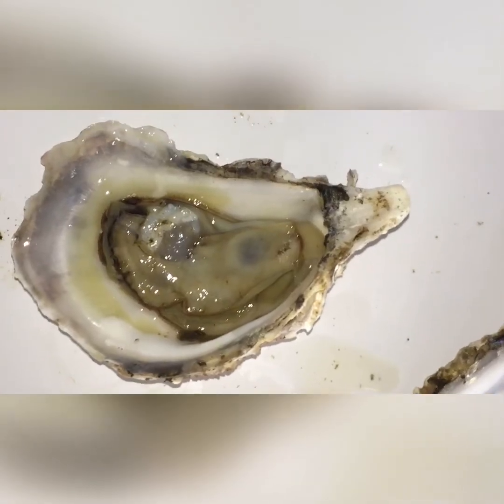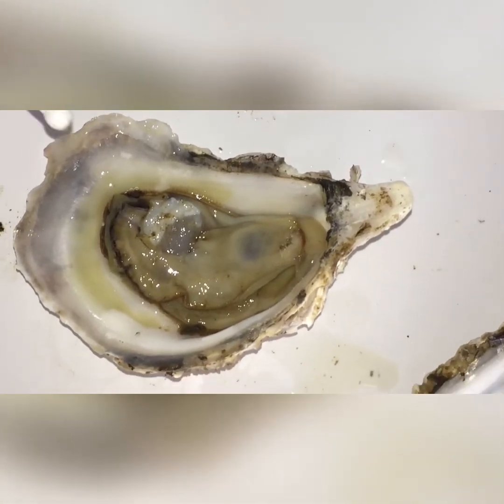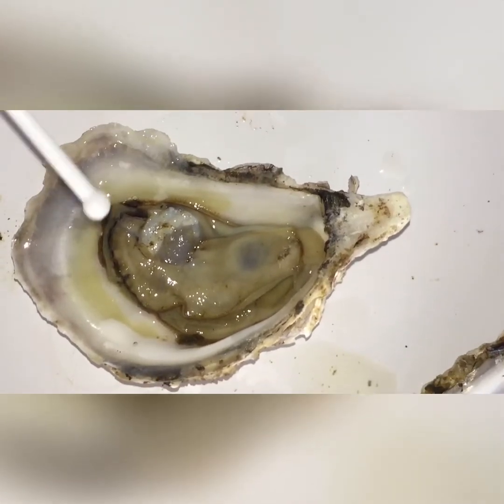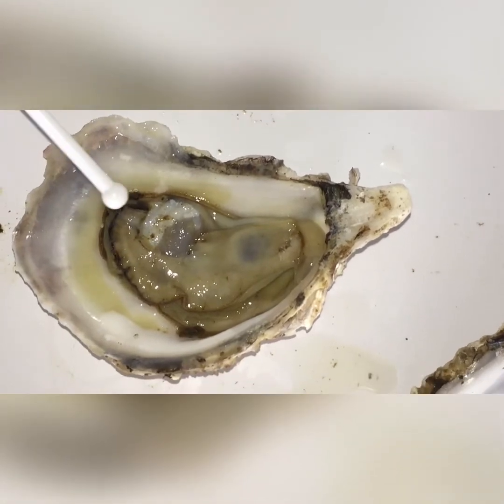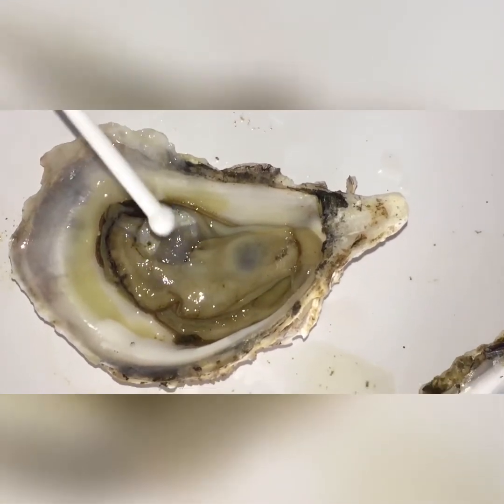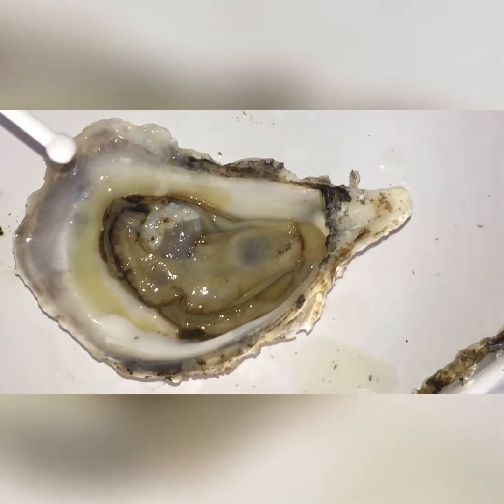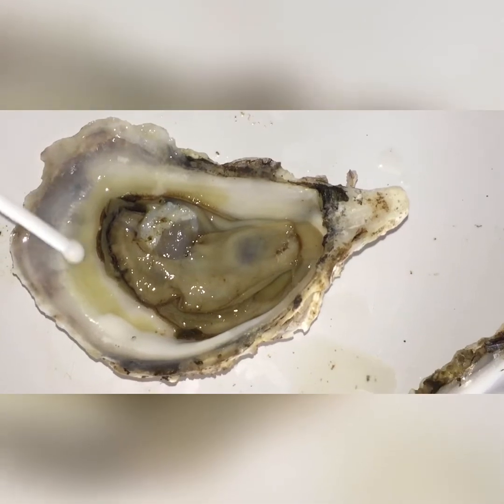Now let's get into our dissection — the moment we've all been waiting for. I went ahead and shucked the oyster so you can see the inside of it. So here's the hinge. A lot of people say the oyster is not very complex, but the oyster is actually more complex than you would imagine. Here is this thin layer called the mantle, which is a thin layer that covers the internal anatomy of the oyster.